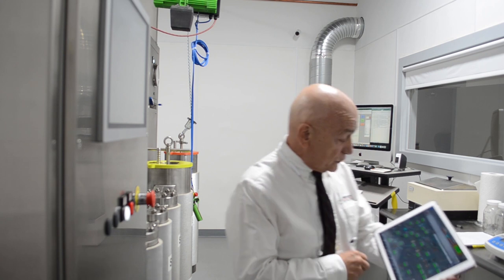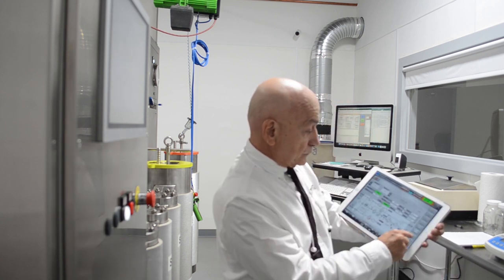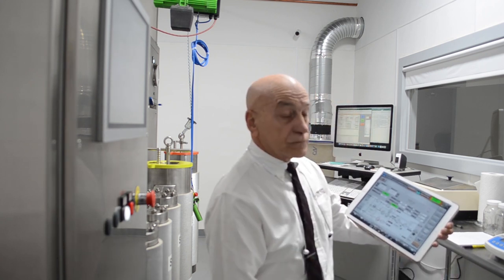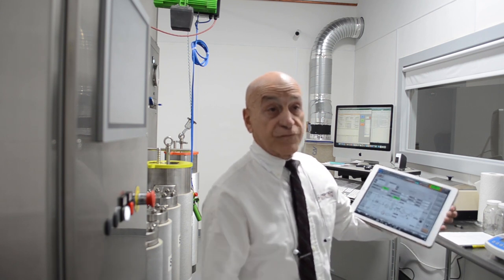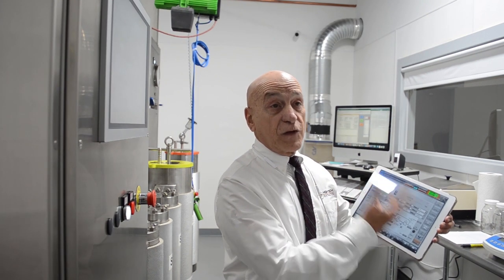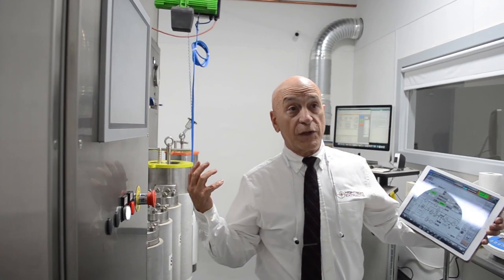And now what I want to do is I want to change the flow rate. And now you can see from my tablet, I changed the flow rate. And you can hear the pump has responded. And we're now building pressure back.